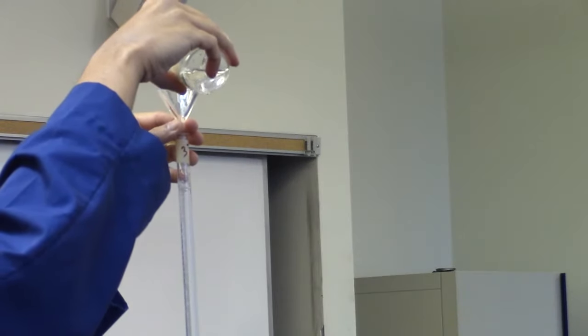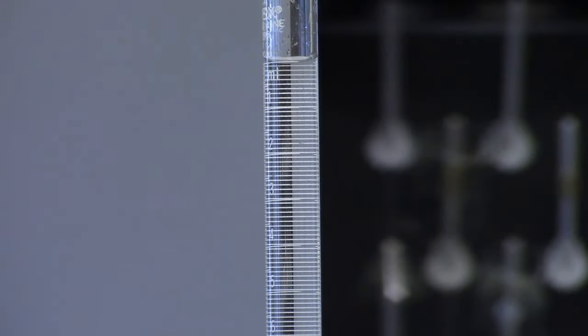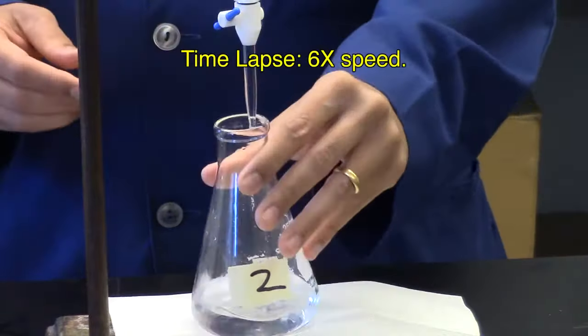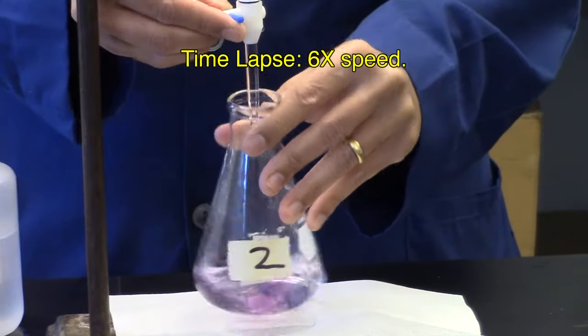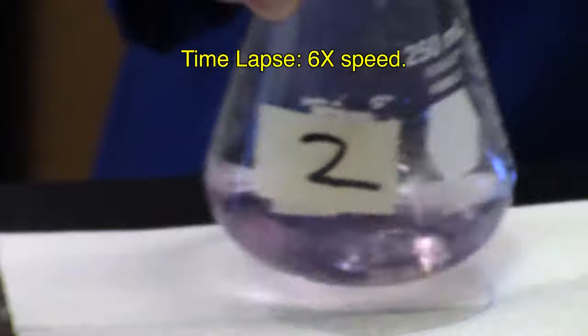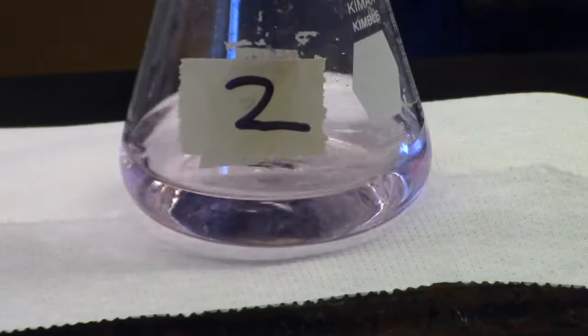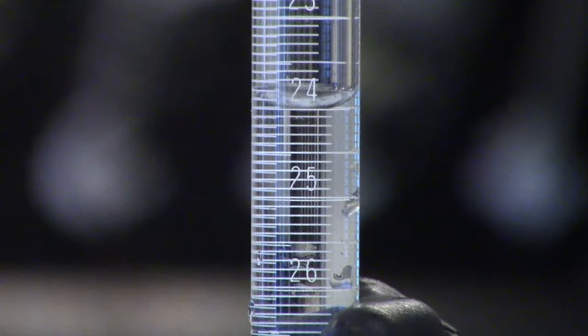Refill the burette if necessary. Record the initial burette reading and titrate the second sample to a light pink endpoint. Record the final burette reading.